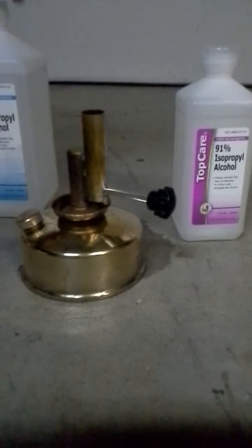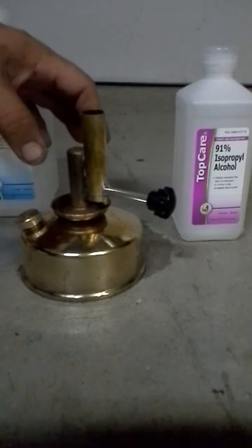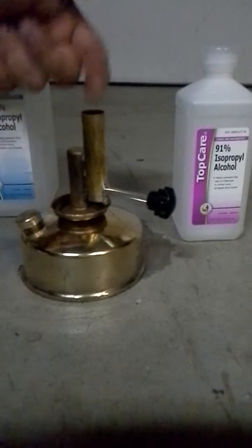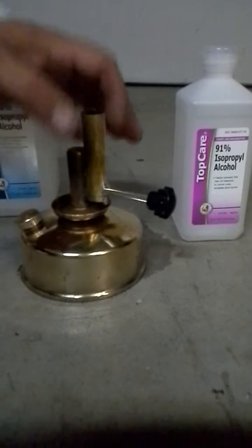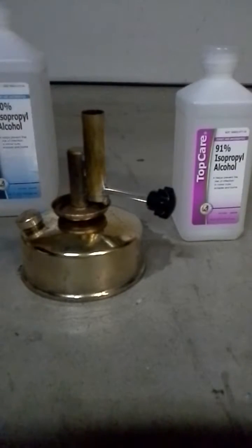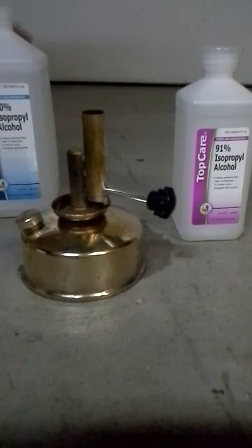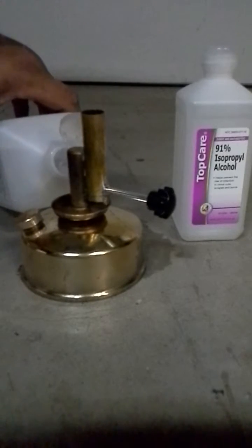I put some of this down here already and we're gonna pour a little bit of this on there. You're gonna light it on fire. It's gonna warm this up — once you hear that turbo sound, almost like a sucking sound, we're gonna let it go for a minute and then we're gonna blow it out. Immediately after that I'm gonna grab my handy dandy torch. I'm just gonna light it here and if everything goes right it'll create the torch effect. So we're just gonna splash a little bit of this on top. I try not to get it everywhere but it always seems to happen anyways.